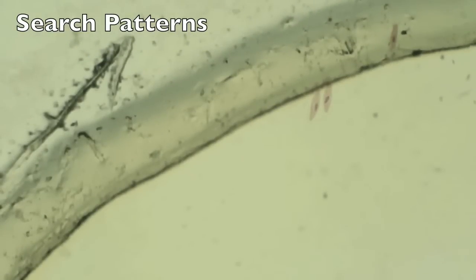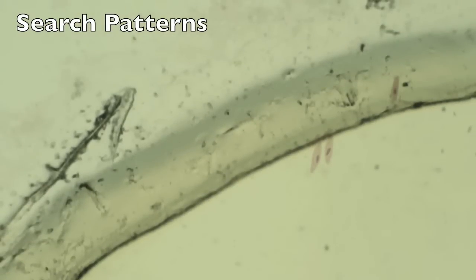Now that we've oriented the microscope in the Z dimension, up and down, we want to look at a search pattern. I always start my searches on microscope slides in the upper left-hand corner, but you should follow whatever protocol is in your laboratory. What you're looking at now is the edge of a round cover slip, and there's a couple of paramecium that are near the edge. And what we're going to do then is we're going to start our search pattern here.